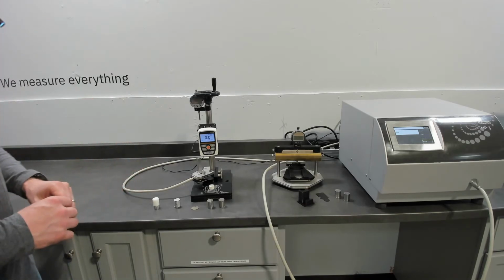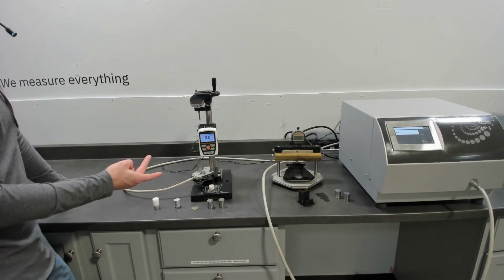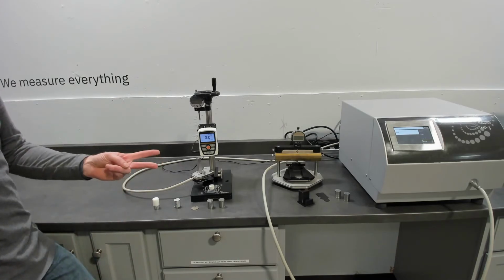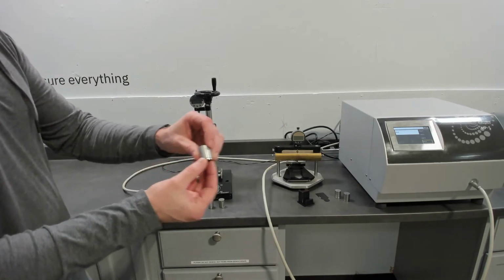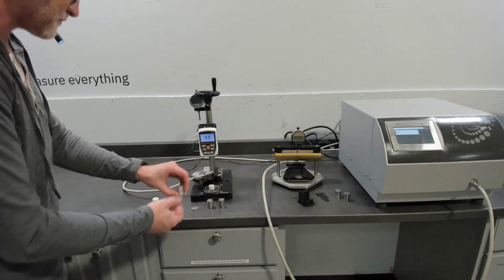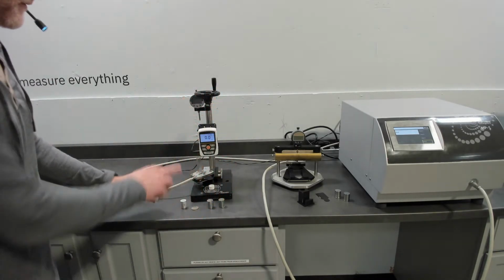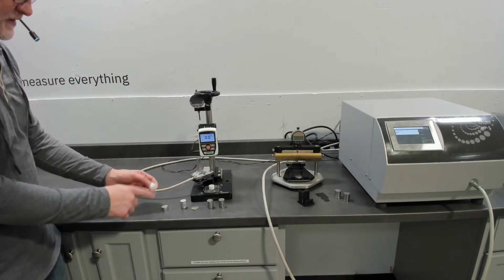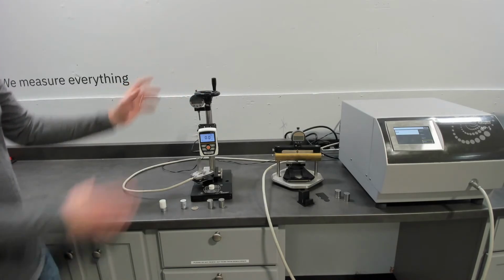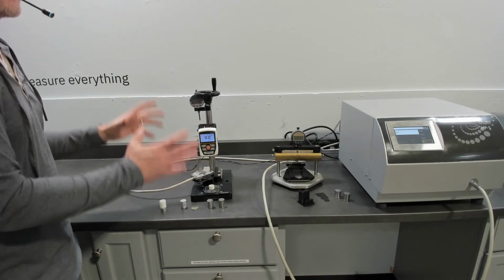And those variables are, instead of doing similar materials, you can do similar materials but also dissimilar materials. So piece A and piece B can be metals, similar metals, or dissimilar metals, or in this case we have steel and aluminum, and then you could have different finishes. In this case we have aluminum and Delrin, again with different finishes. So we can vary the materials. You can vary the surface finish, as well as vary the compression, as well as, in this basic setup, this is room temperature, you can also vary the temperature. So the temperature that the sample is sitting at.